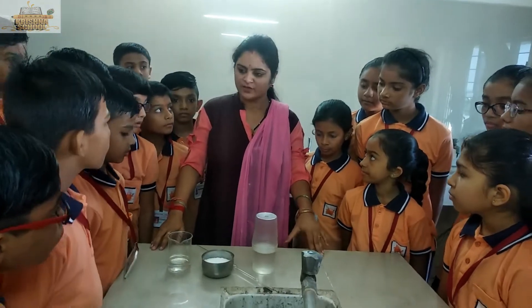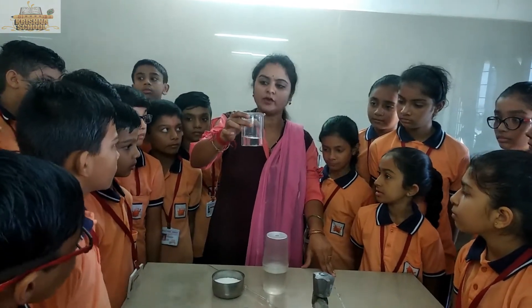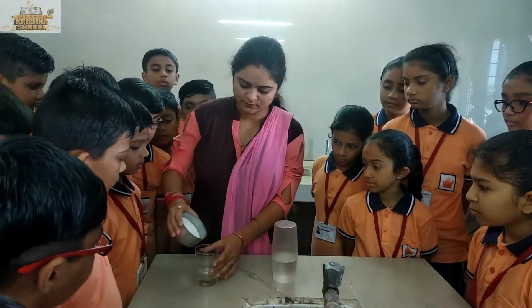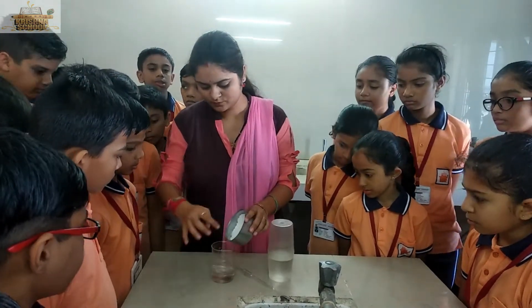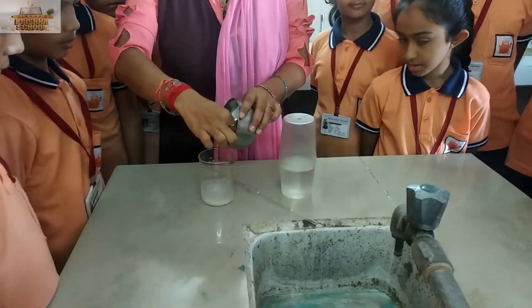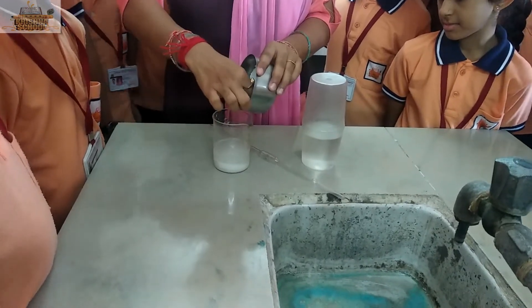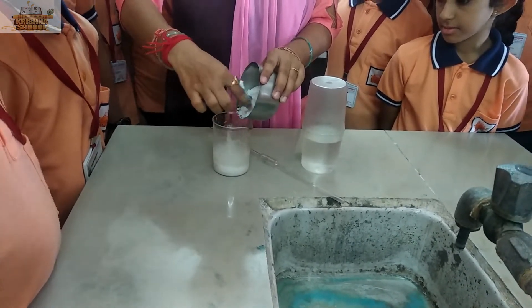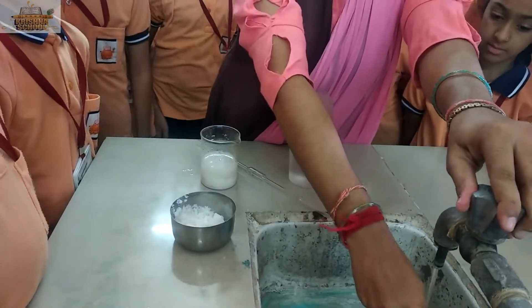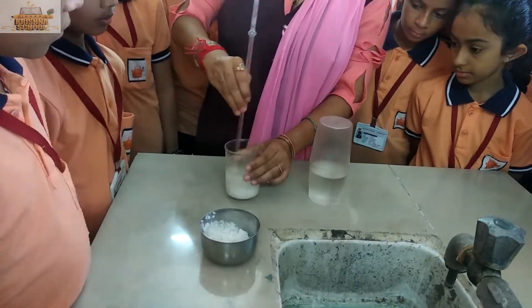So for performing this practical, first of all, we have to take this beaker in which we are having normal tap water, and we will add salt in it and let's see what happens. Now we will mix this salt in this tap water like this.